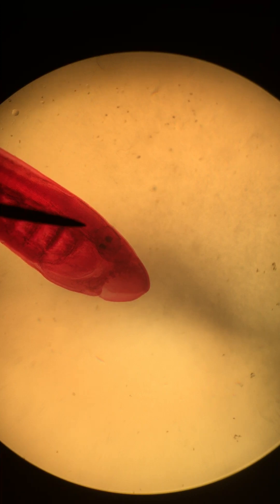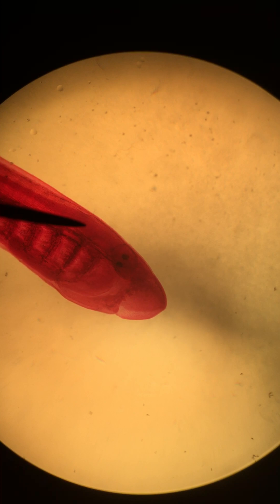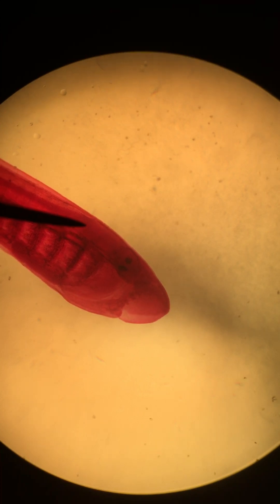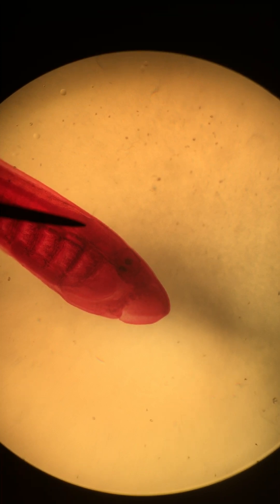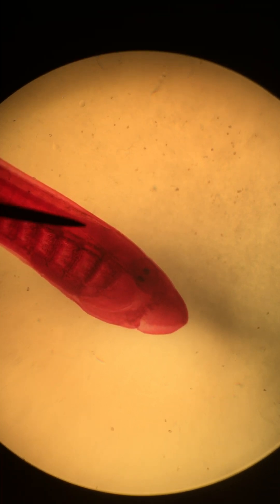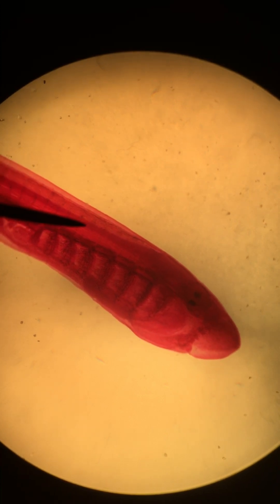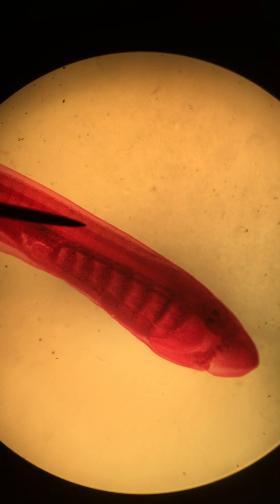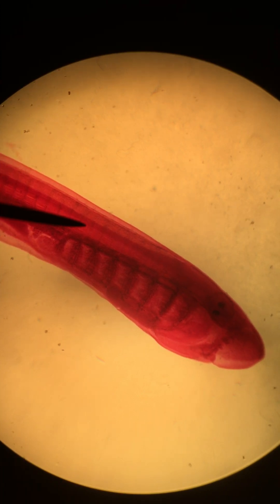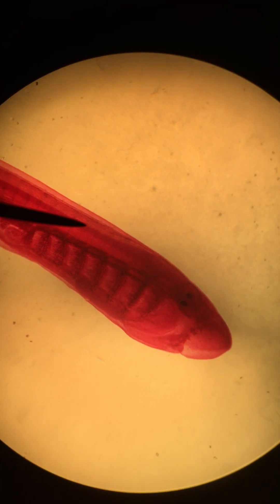Just caudal to the eyes, you can see a darker pigmented, enlarged structure here. This is its brain. And it leads to the spinal cord — the dorsal nerve cord, which we are now referring to as the spinal cord. It runs the whole length of the body, head to tail.